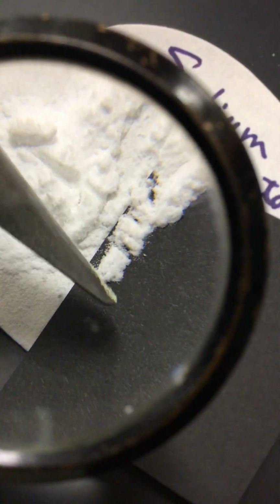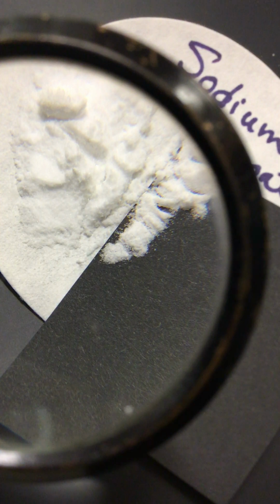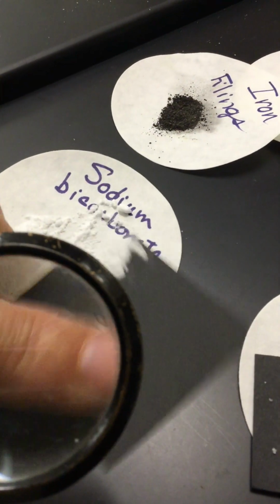I'm doing this left-handed, and I'm definitely not ambidextrous. Ooh, I have sulfur on there. So that is sodium bicarbonate. I hate to move this because it's going to get all messed up, but here's the name. Sodium bicarbonate. Okay, as I knew that would happen. Okay, there's sodium bicarbonate. Our next substance is sodium chloride.